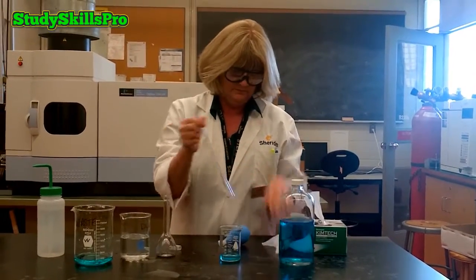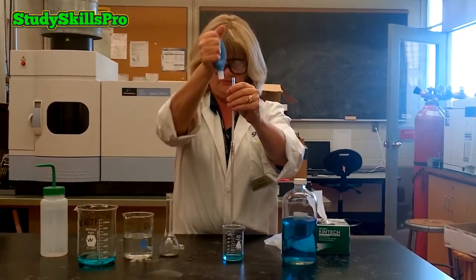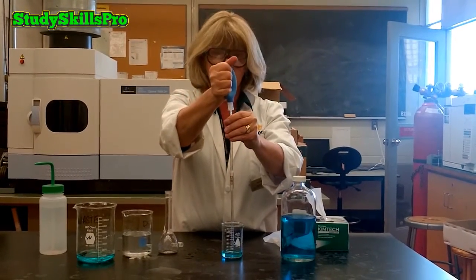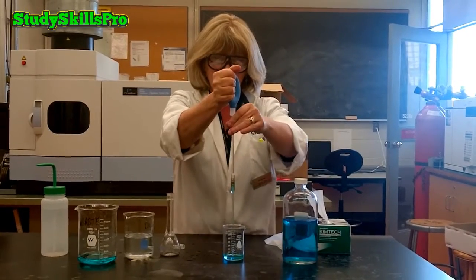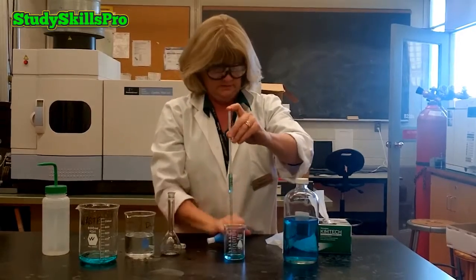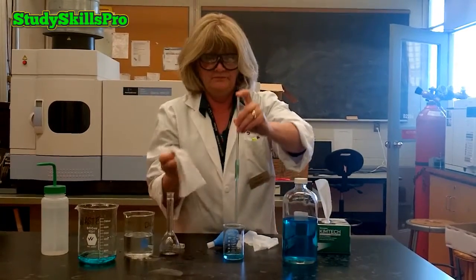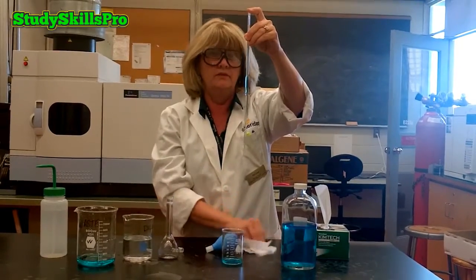The first step in pipetting will be to expel all of the air out of the bulb. You would then gently place the bulb on the top of the pipette and allow the solution to fill the volumetric pipette. Allow your pipette to fill until the solution is past the calibration line that is etched onto the pipette.